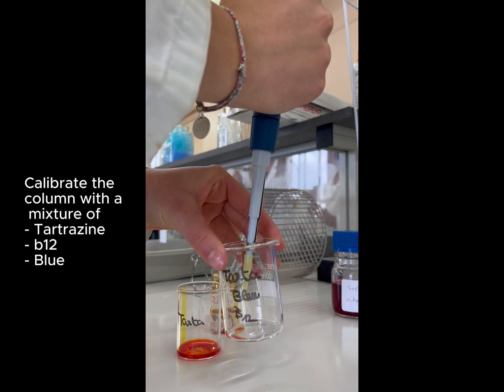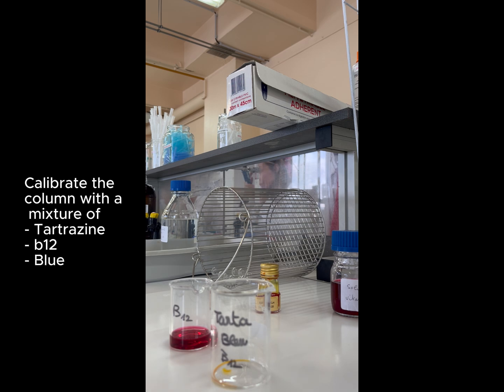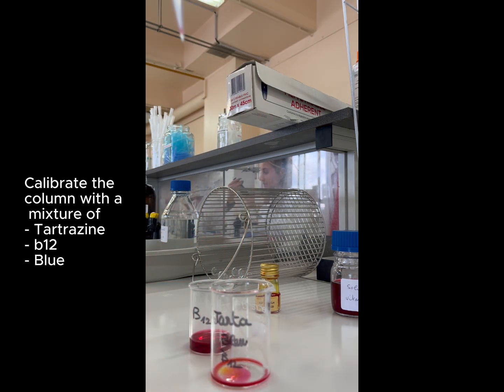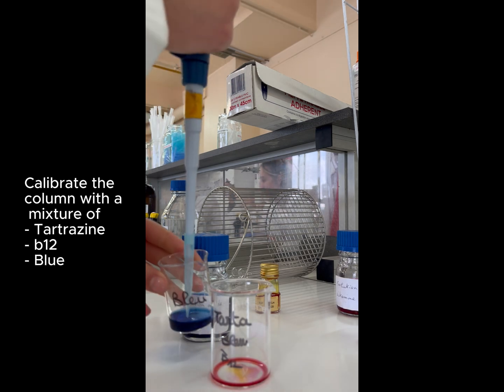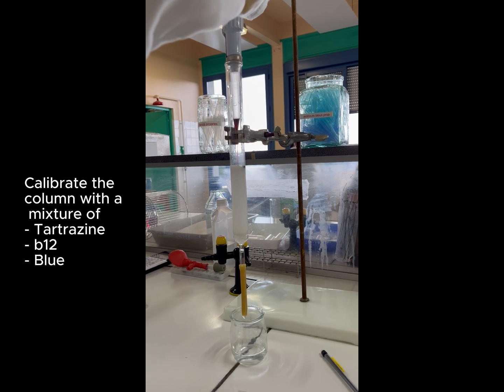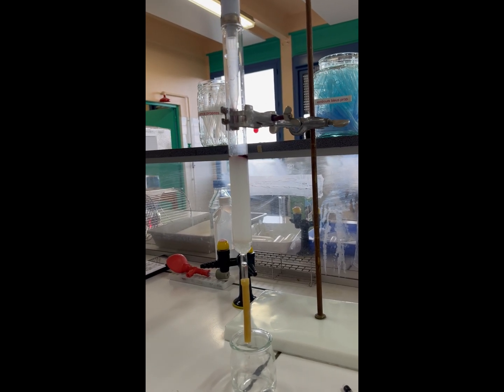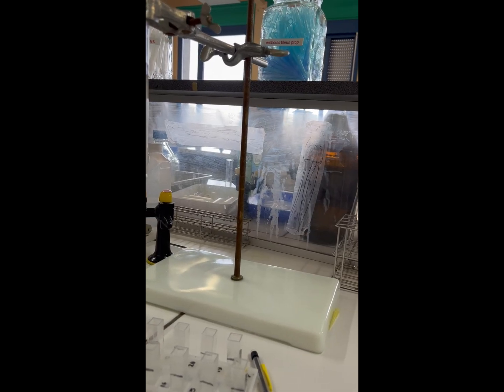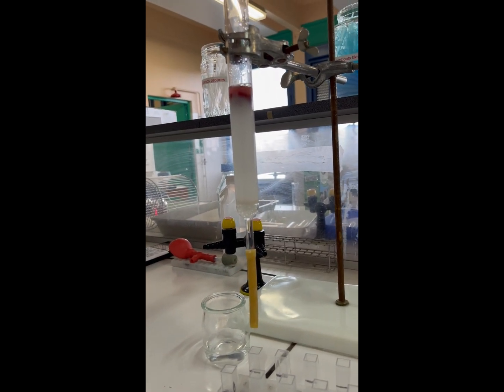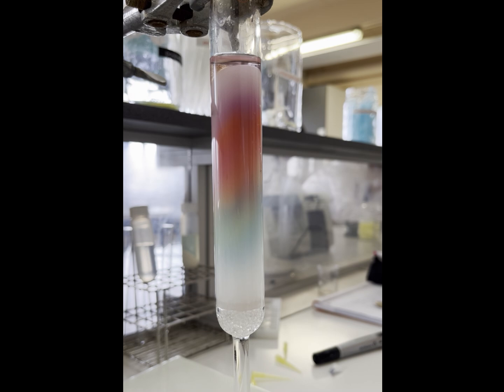Secondly, we need to calibrate the column. We make a mixture of blue dextran, vitamin B12 and tartrazine. The mix is added to the gel in the column. Once this has penetrated the gel, more water is added to prevent the gel from drying out.